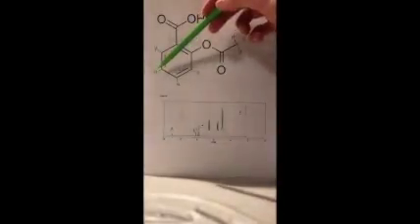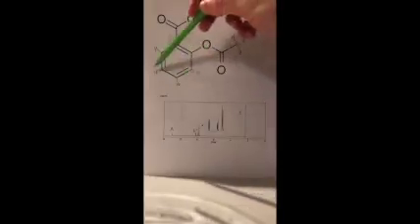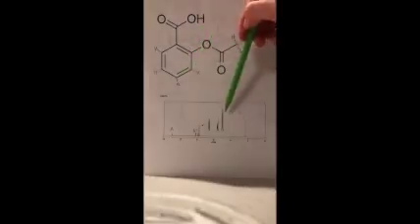And then also we see, in the zoomed in version, there are many different peaks in these signals. This is due to a phenomenon called spin-spin coupling, which I mentioned before with the spectrum for ethanol. Basically, there are some peaks due to the neighboring hydrogens. So this peak should be a doublet, but as we can see, there are many different peaks in this signal. This is due to the spin-spin coupling.